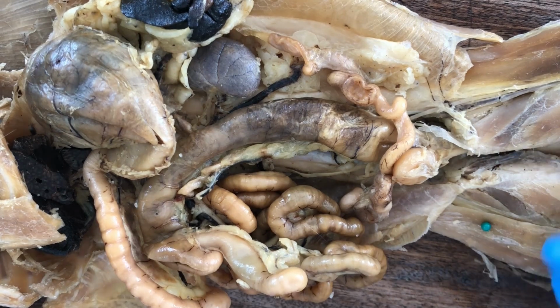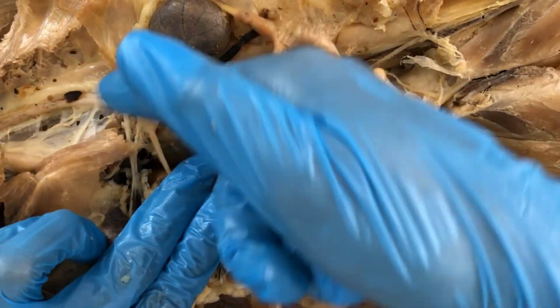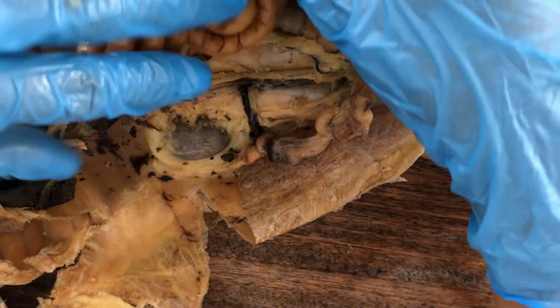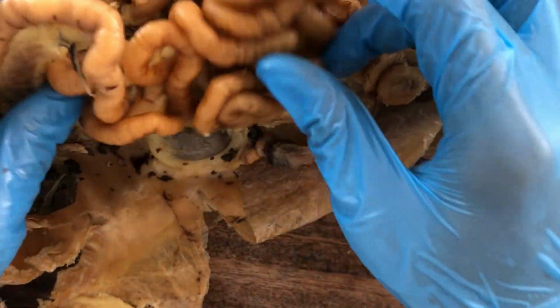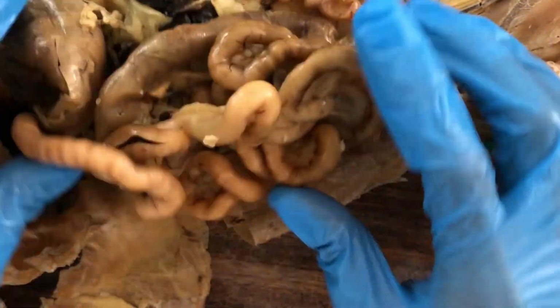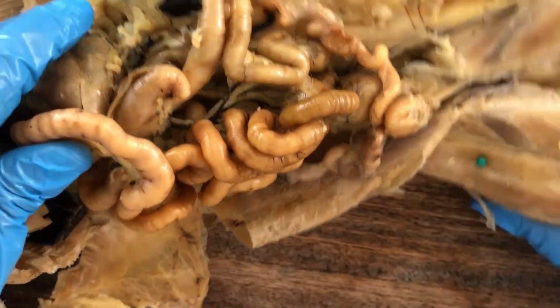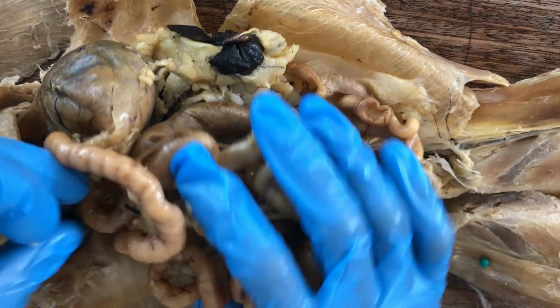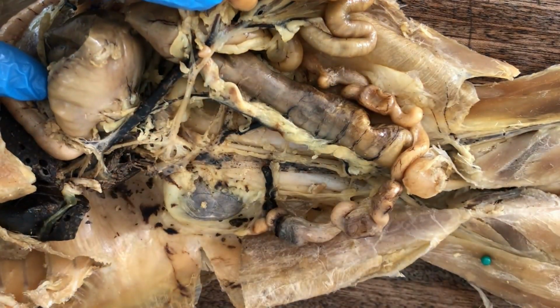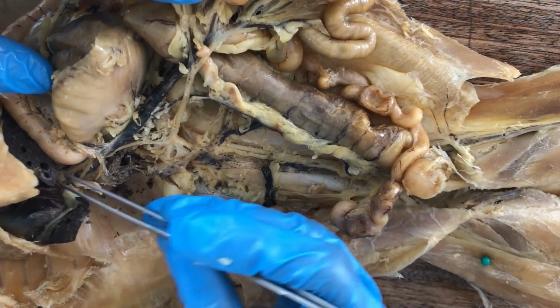Coming next are the veins. So it's a circuit, right? These arteries will supply blood to the viscera, and then the blood, now nutrient rich along with the waste products of the viscera, the veins will collect the nutrients that have been absorbed by the intestine. And those veins are the tributaries of the hepatic portal system, going straight for the liver.